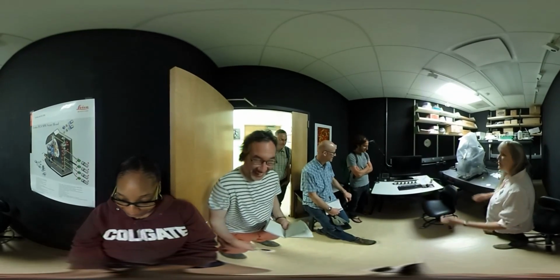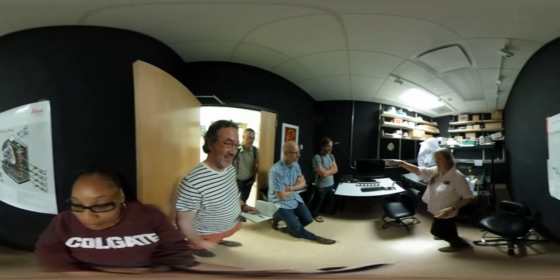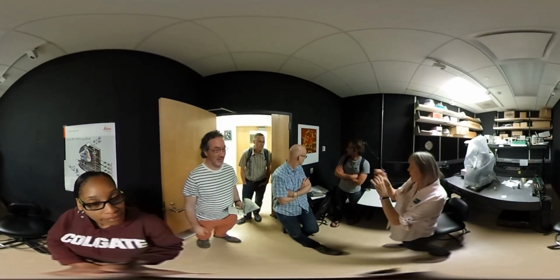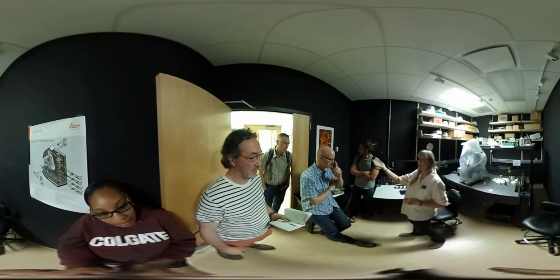Yeah. So you know what the light spectrum is, okay? So this can collect image data using any light in the whole light spectrum. If you look behind you, oftentimes we can color plant parts, pieces, viruses, whatever you want to look at, with fluorescent dyes, with fluorescent tags.